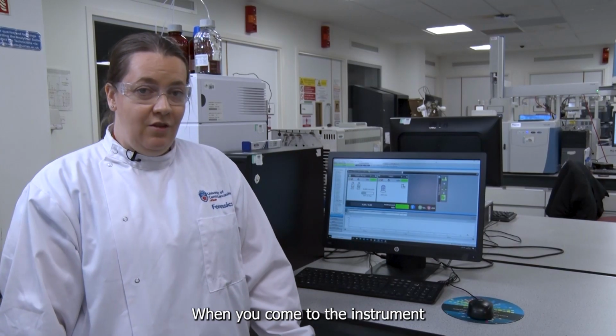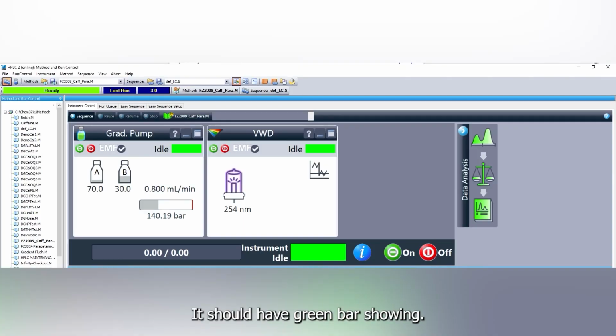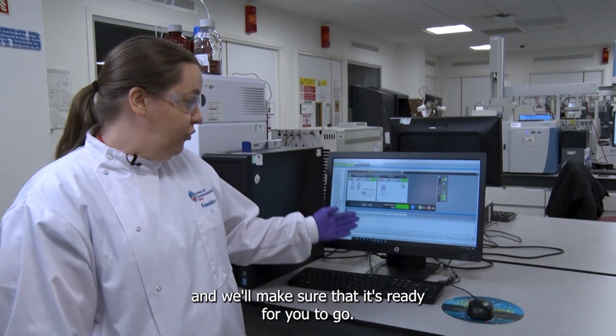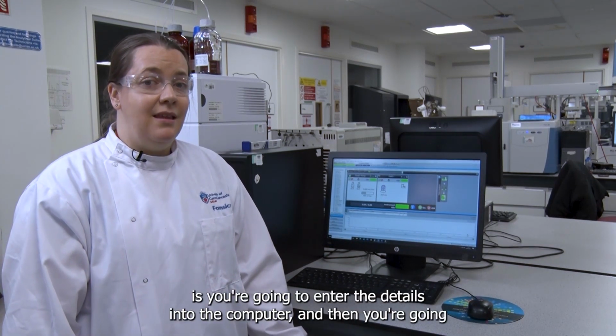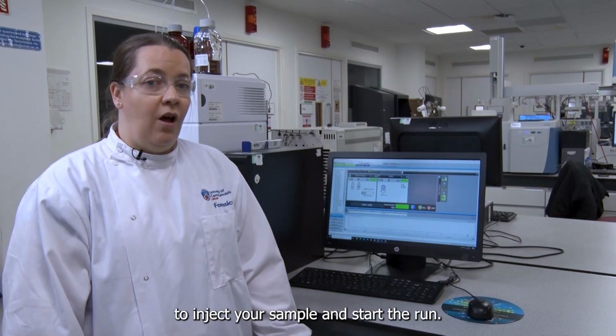When you come to the instrument, it should say instrument idle. It should have a green bar showing. If it isn't, find me or one of the technicians or the demonstrator and we'll make sure that it's ready for you to go. When you're going to run the sample, the first thing you're going to do is enter the details into the computer, and then you're going to inject your sample and start the run.